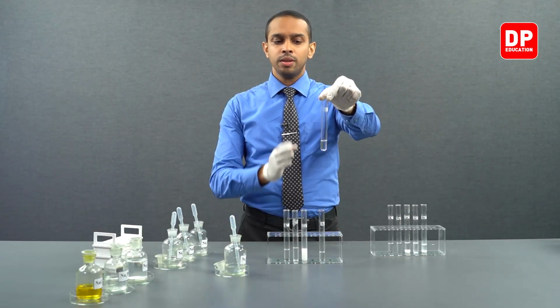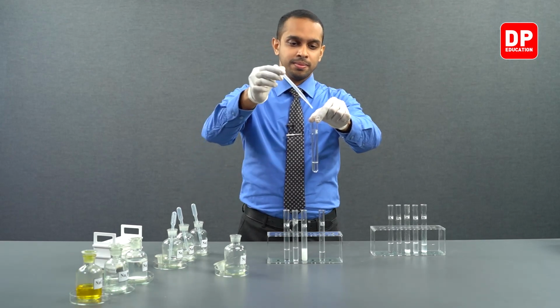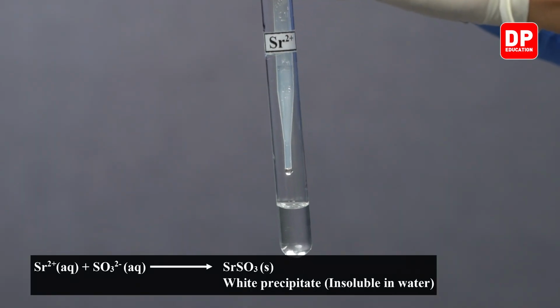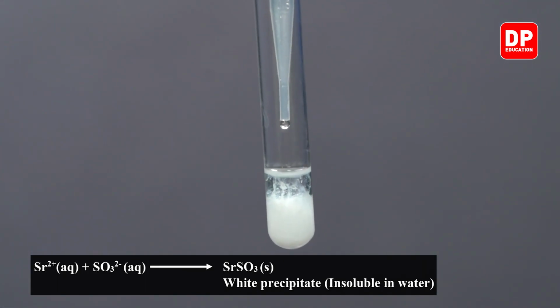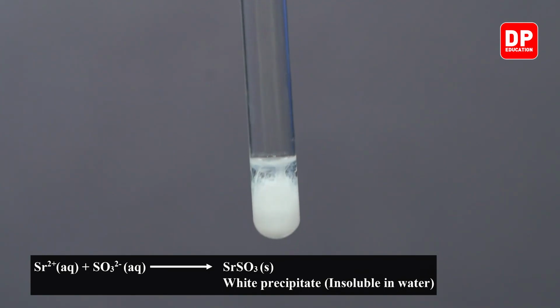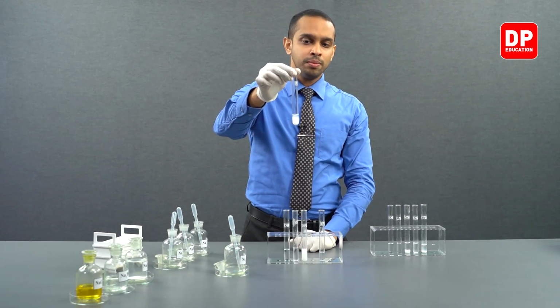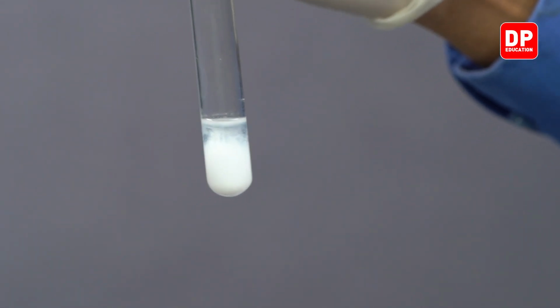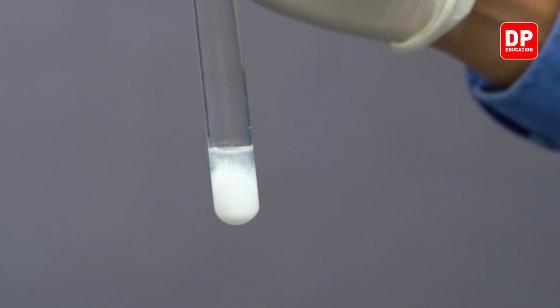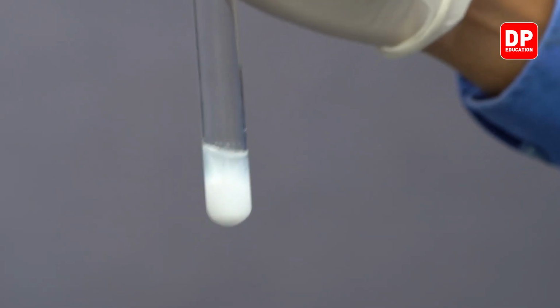Now, let's take our strontium 2+ aqueous ion solution. And to it, let's add our sodium sulfite. By adding sodium sulfite, we introduce sulfite anion, and you can see as I add sulfite anions into strontium 2+ aqueous ion solution, a white color precipitate started to form. This is strontium sulfite, which is a white color water insoluble precipitate.